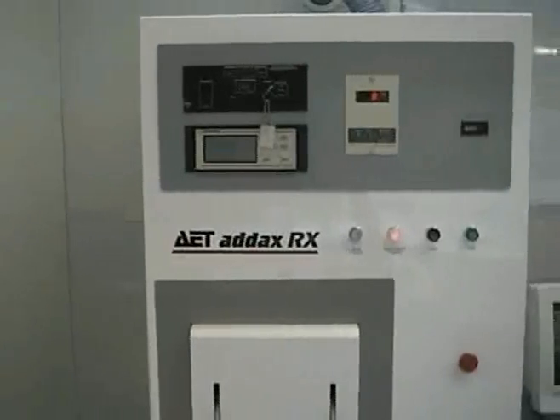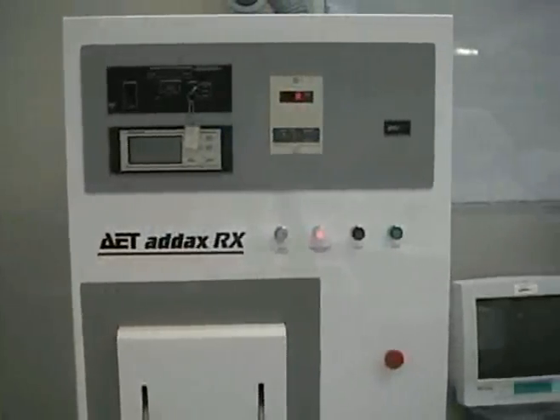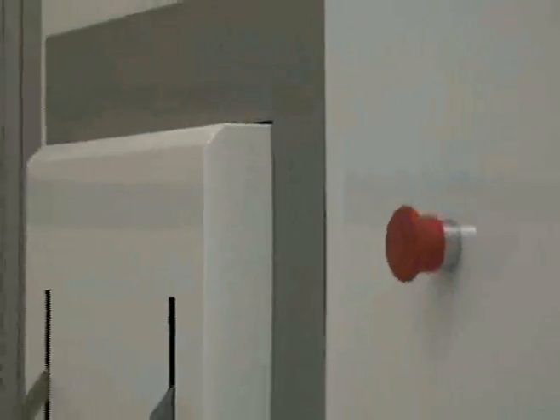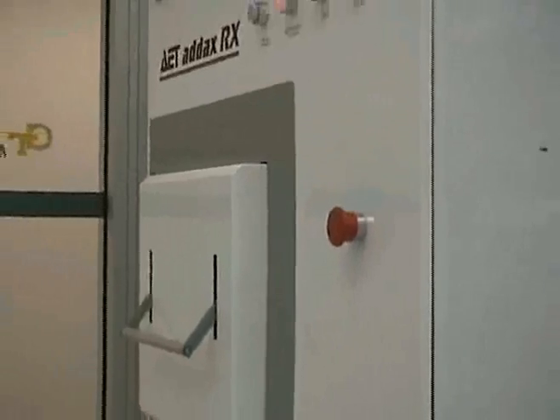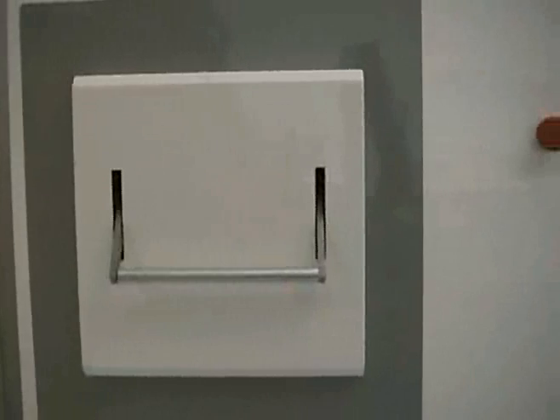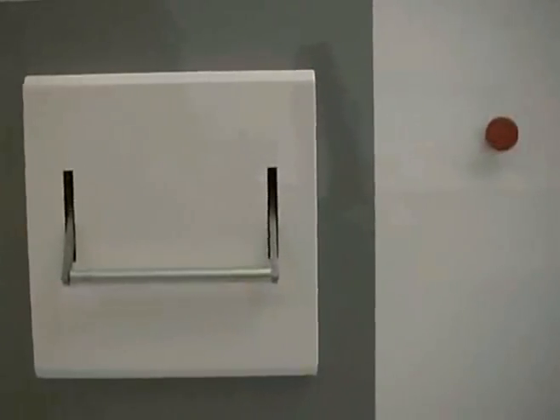Rapid Thermal Processors, or Rapid Thermal Annealers, are used to rapidly heat a sample for annealing or other purposes. The RX machines are part of the family of manual furnaces for rapid annealing by infrared radiation. They can also be used for implant annealing.